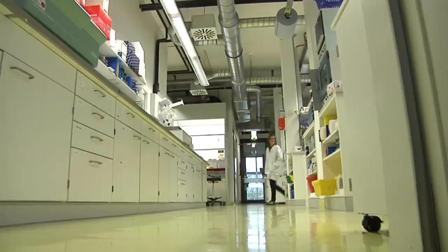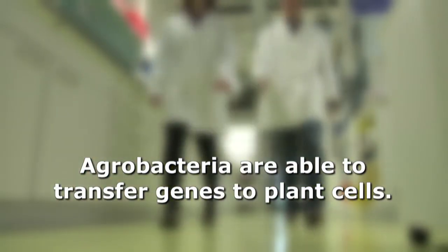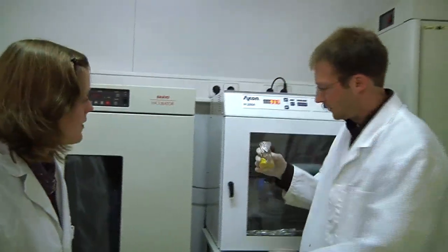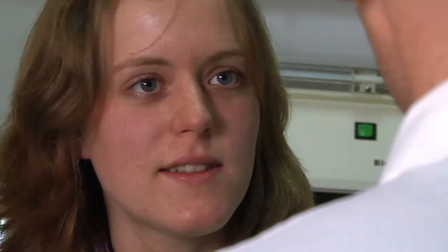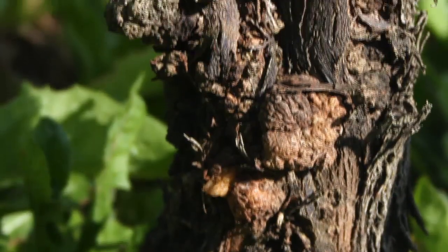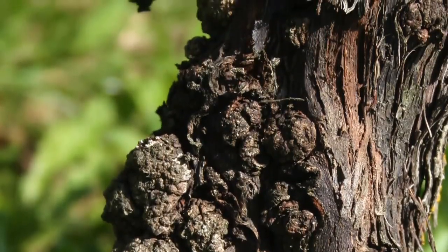Let me show you our AgroBacteria. These are the AgroBacteria. They are a naturally occurring species of soil bacteria, which are able to transfer genes to plant cells. Why do they do that? The bacterium reprograms the plant and causes the plant to form a tumour in which the bacterium can then grow. We take advantage of this natural capacity of the bacterium to transfer any other genes of interest.